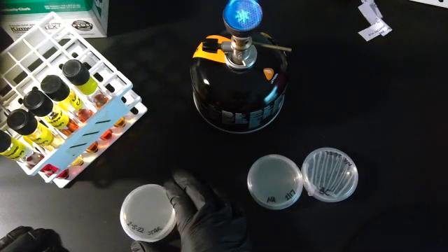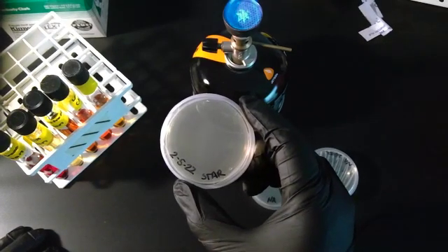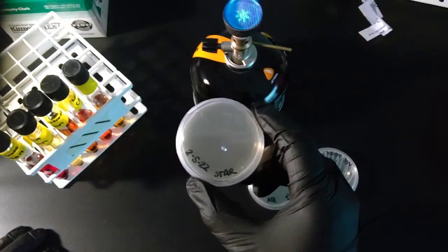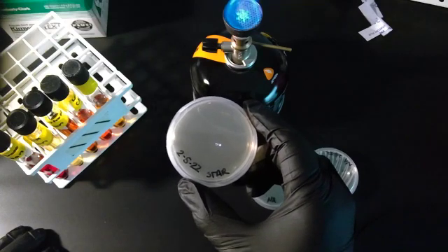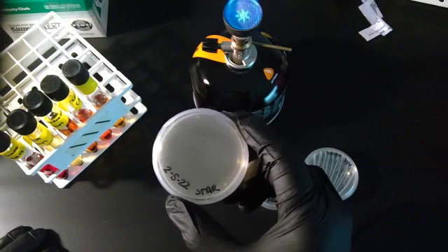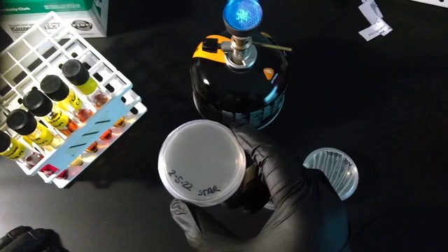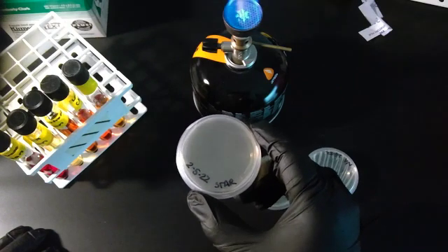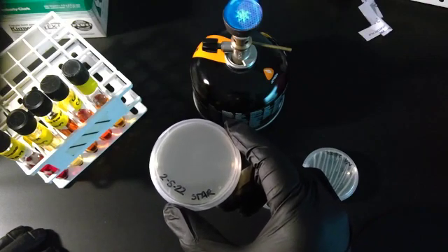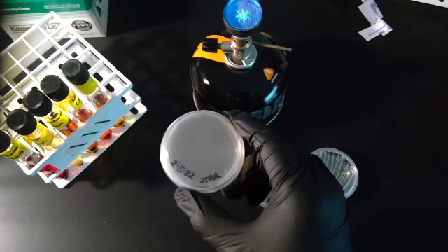I also needed to do a starch digestion test. So here is a starch plate. The starch is in the actual agar itself. And as I said in the previous video, in the lecture video, if you put starch and iodine together, it's going to turn black. If, however, you've had starch digestion with your sample, you are not going to have to worry about seeing black because there's no starch there. So the iodine stays amber.